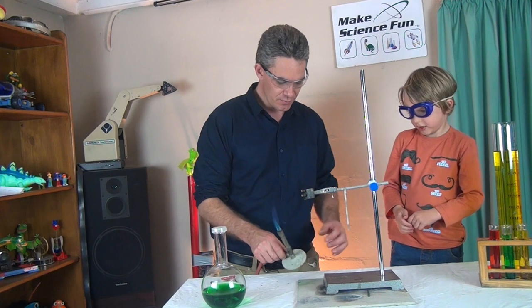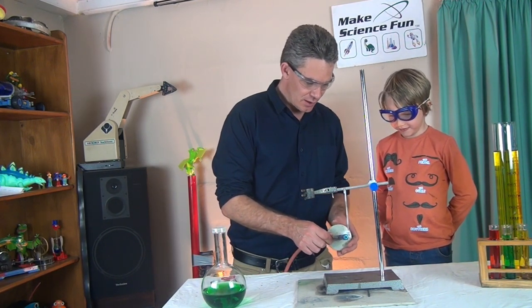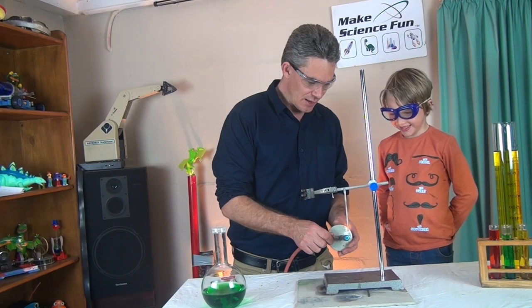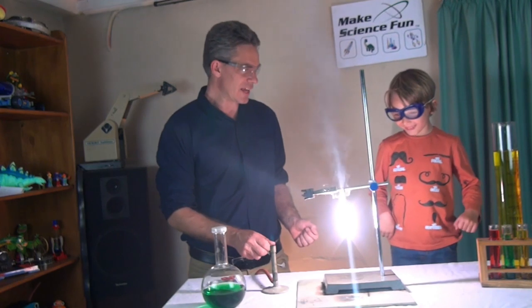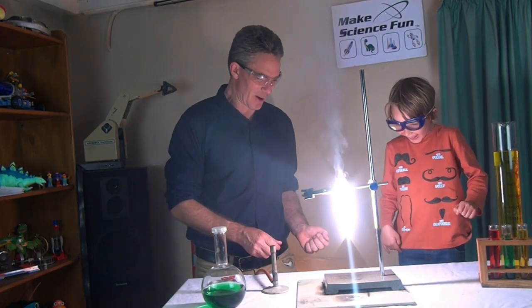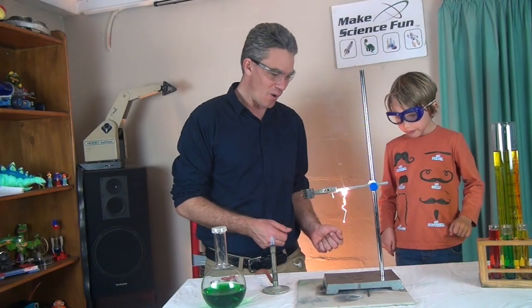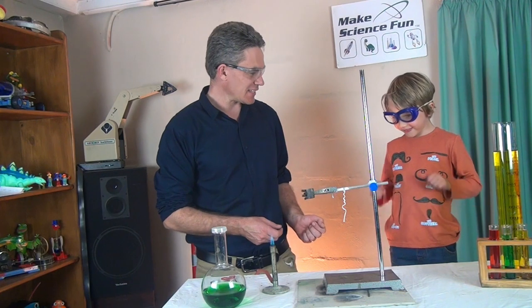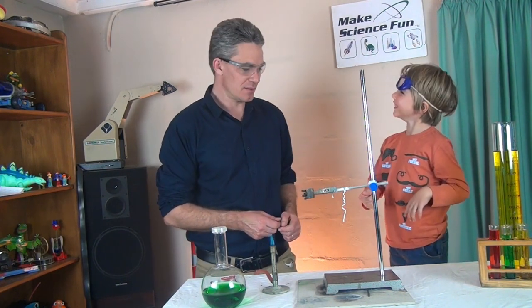I can't. Daddy, help you? No, I'll hold it. Okay. Go like this. Let's see what happens. Look at that, Sam. Is it bright? It's a bright light, isn't it? That is super bright. Wow. You can make flares out of that. They shoot them up. Is it hot? Not anymore.